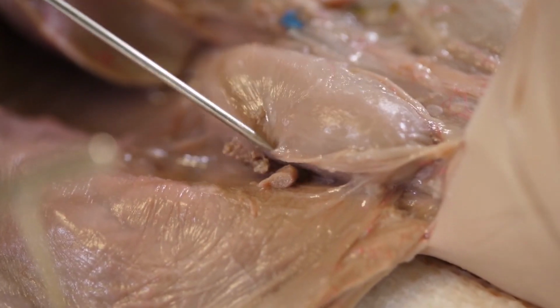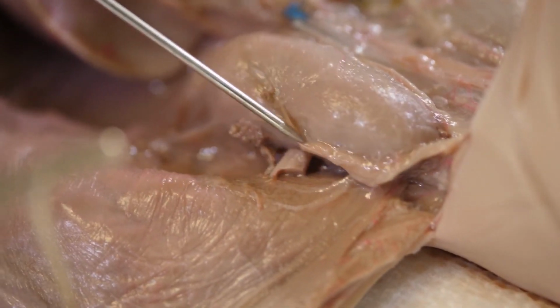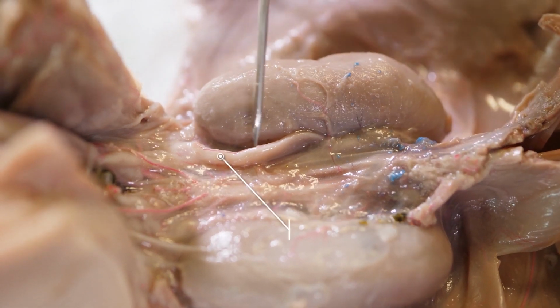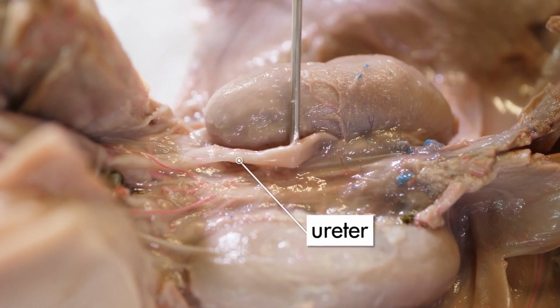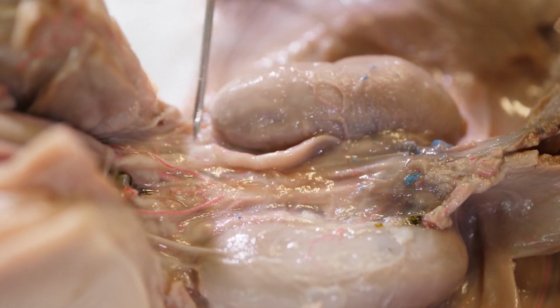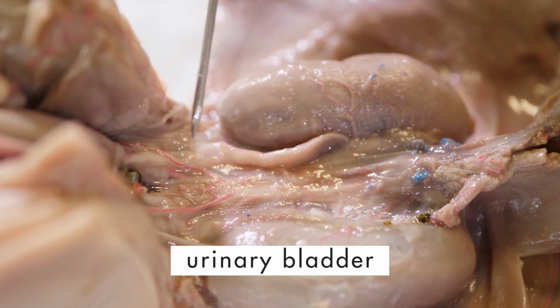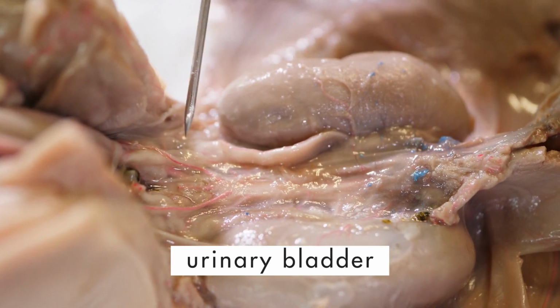To get a better view, we need to pick away the membrane surrounding a kidney. The kidneys filter liquid waste out of the blood. This waste is mixed with water to produce urine. Urine passes from the kidneys into the ureters. After passing through the ureters, the urine flows into the urinary bladder, which is located in this region, but it is deflated and difficult to see.